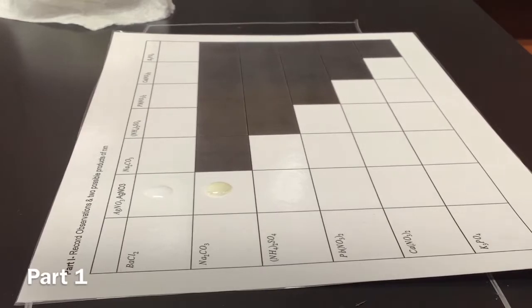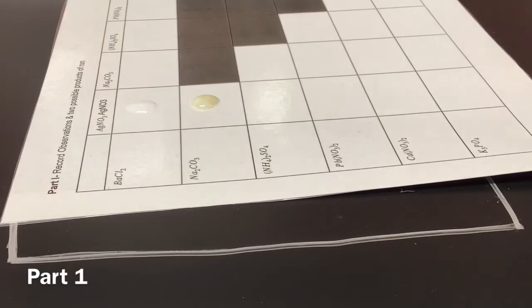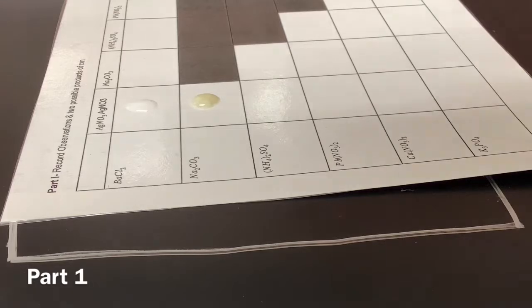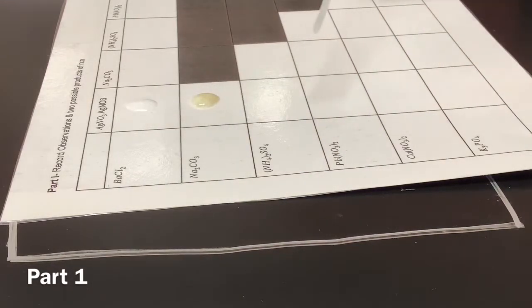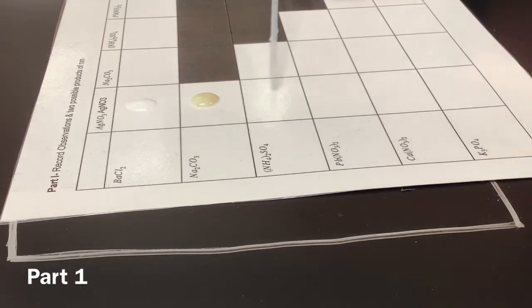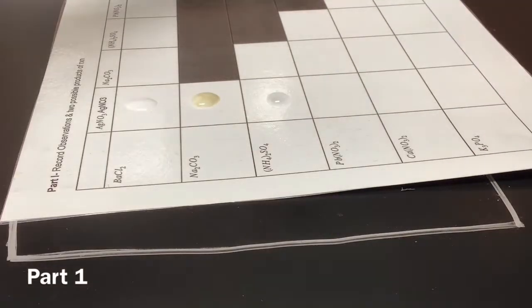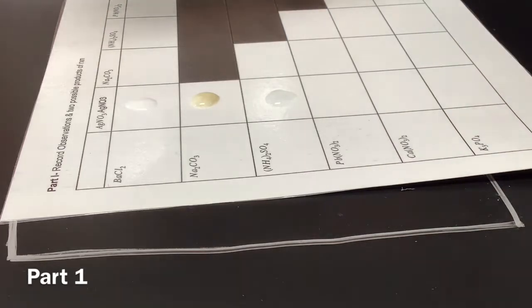Okay, so it became yellow. Okay, here, you need to write all this stuff. I know. I don't have a pencil. There you go. Okay, write that down. Okay, and now we're gonna do AgNO3 with (NH4)2SO4. I could look it up. It became yellow and it's cloudy. Yeah, that's true. How would it balance though, if they're bonded beforehand?